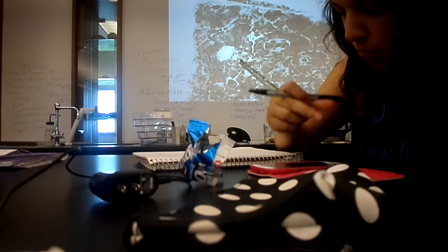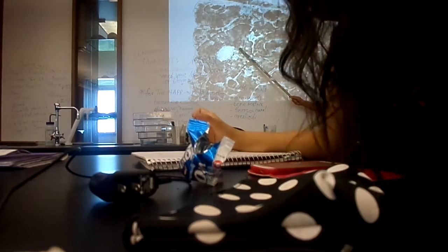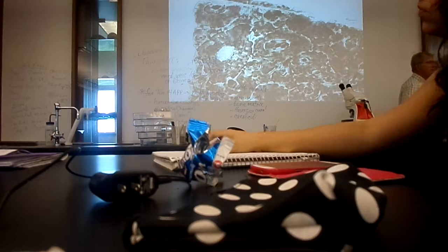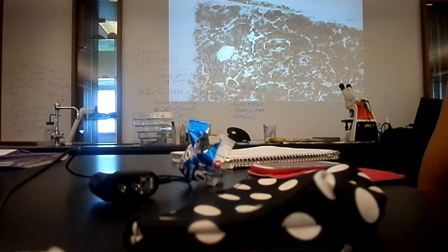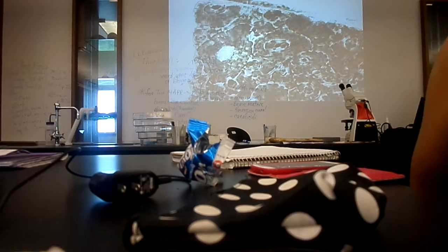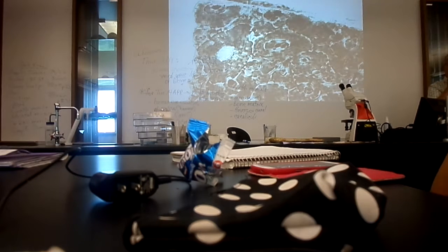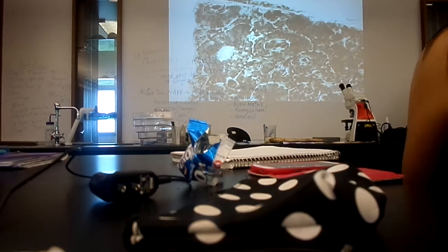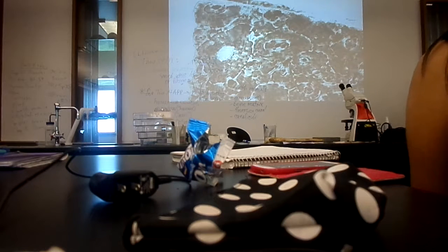The bone cells were, notice that's past tense, located in these dark objects. Now let me show it to you on this chart because it's a little clearer than that display. These dark rectangular objects are not structures, but they're holes in the bone matrix. And that's where the bone cells were located when this tissue was alive. But the cells are not present. Now, the function of these bone cells, like we just finished in lecture, is to secrete bone matrix.